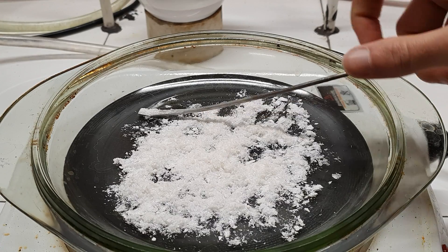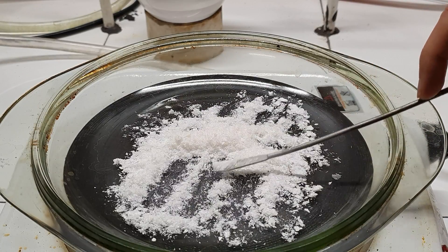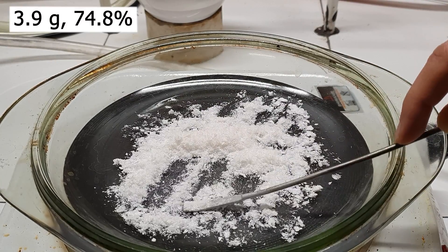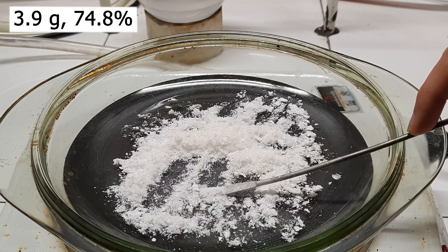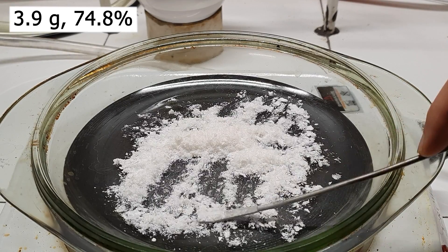After an hour I was left with some perfectly dry powdered aspirin. My yield was 3.9 grams which corresponds to a percent yield of 74.8.